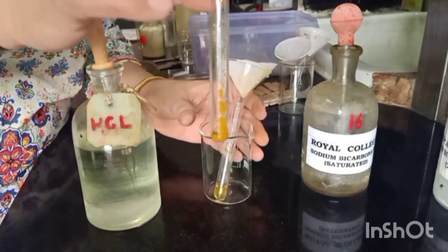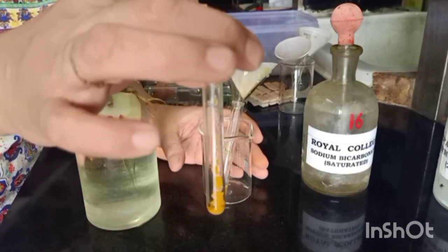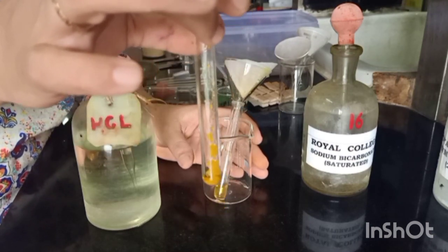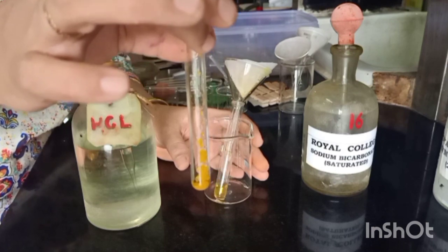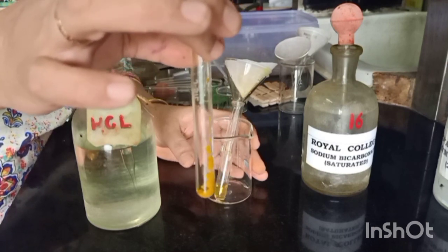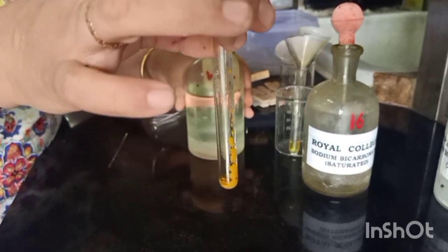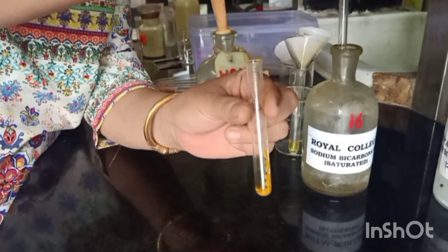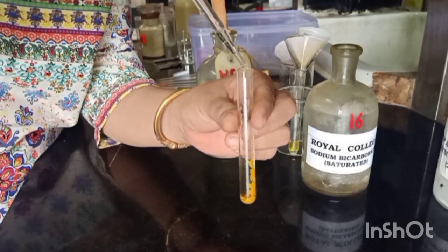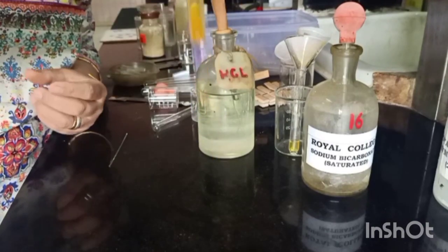We have the residue over here, and we need to ensure that there is no presence of an acid in this, because the presence of an acid would interfere with future tests. So how would we ensure that? That would be by adding a little more bicarbonate — we call it washing with bicarbonate. So let's wash this with bicarbonate to remove any traces of acid that may be present.